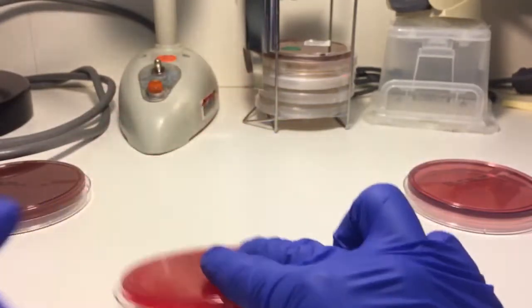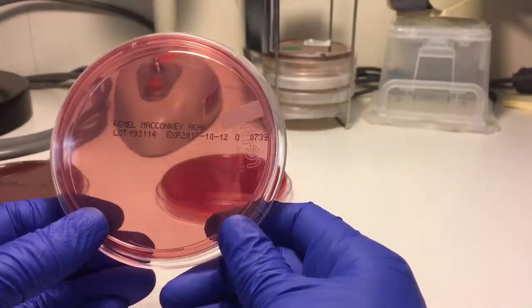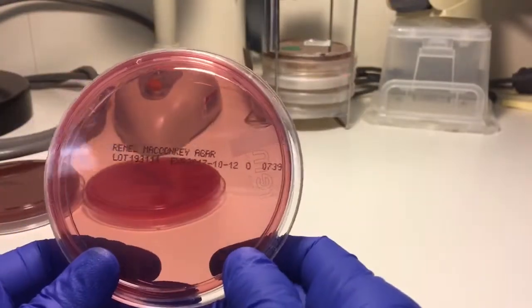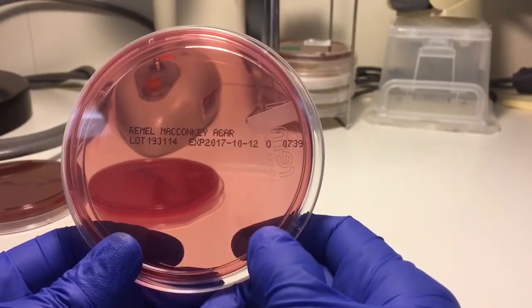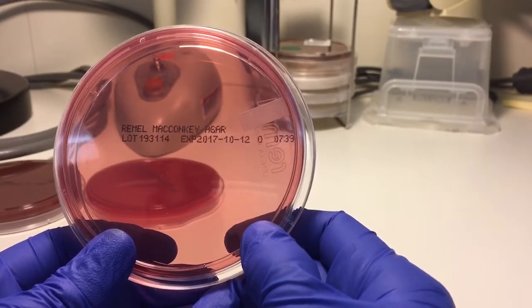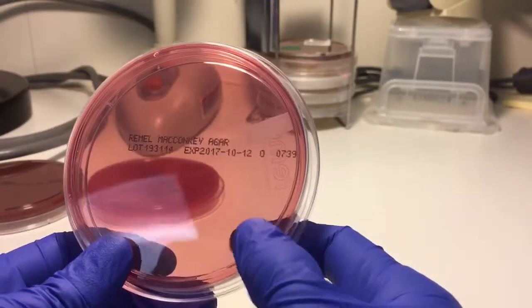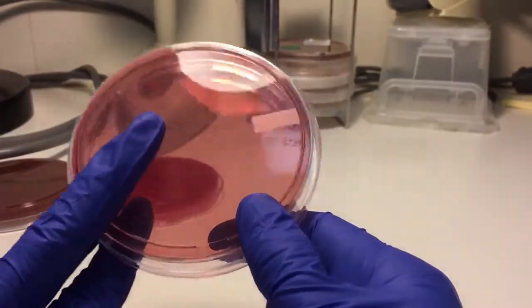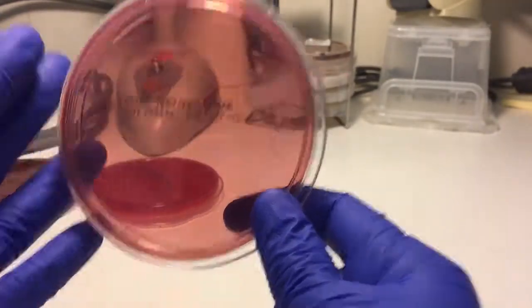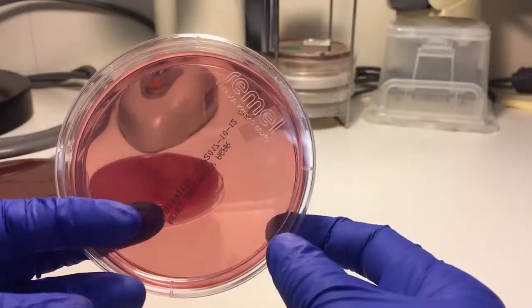This is the MacConkey plate. MacConkey acts as both selective and differential. It promotes the growth of gram negative bacteria and contains lactose, bile salts, neutral red, and crystal violet. It is selective in that it grows only gram negatives, and it is differential in that you can visualize both lactose fermenters and non-lactose fermenters.